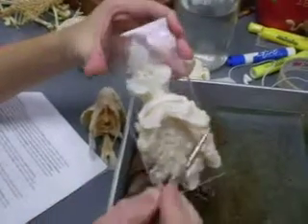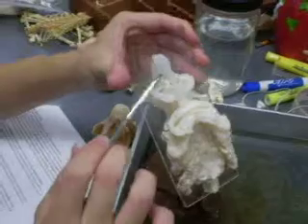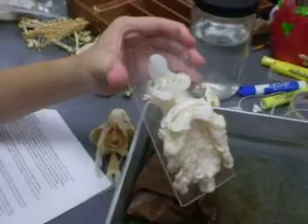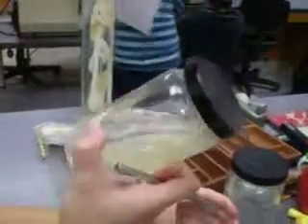The neurocranium is right here — the whiter part. The chondrocranium is the clear translucent part. We are focusing on just the chondrocranium; we don't explain the neurocranium.